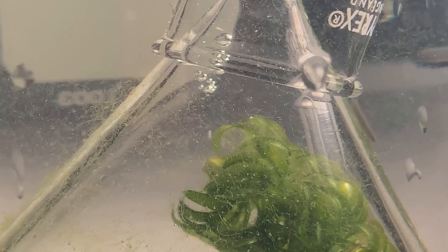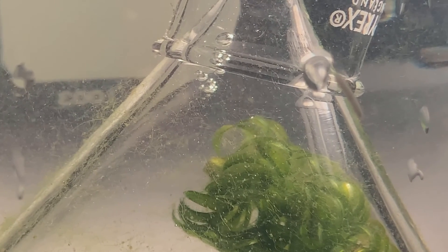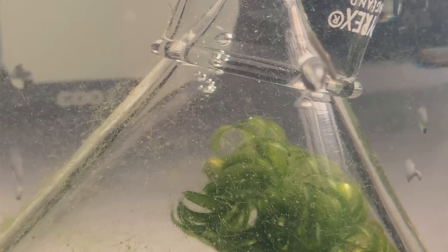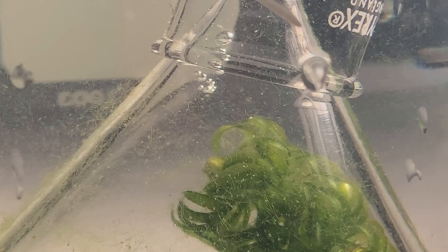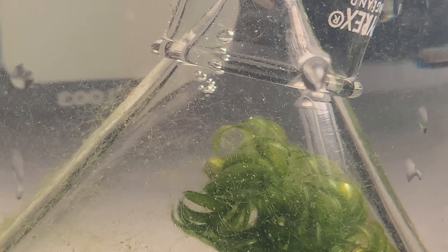This plant is 5 centimetres away from the lamp. Count the number of bubbles produced in 30 seconds, then double it to find the number of bubbles released in one minute, and record this in your results table.